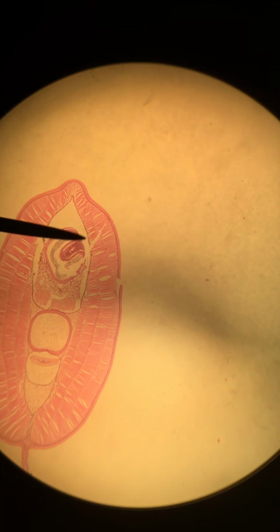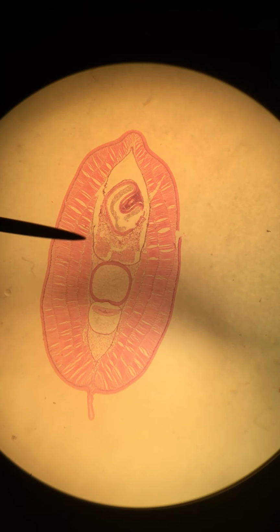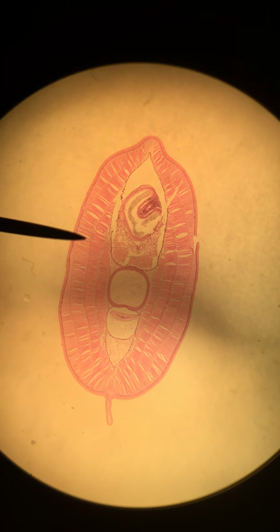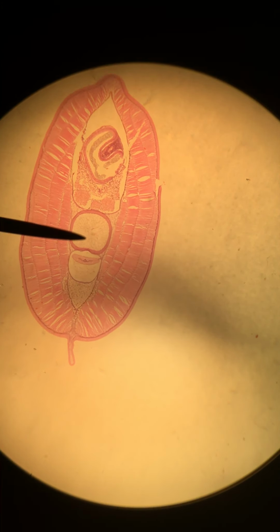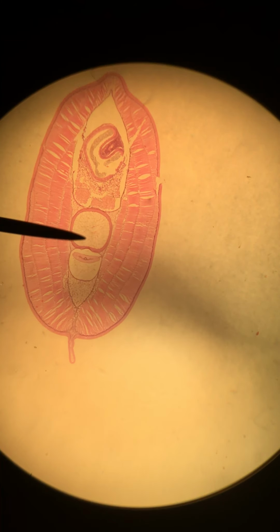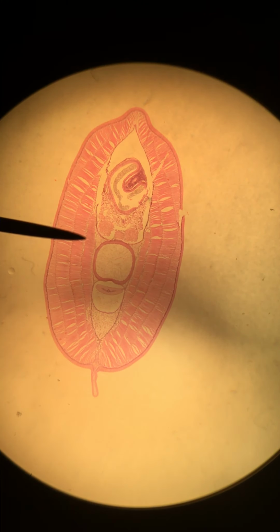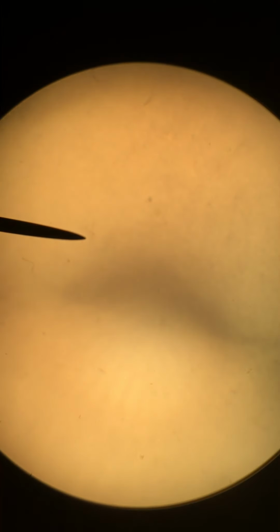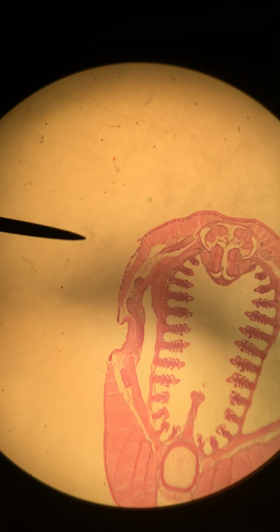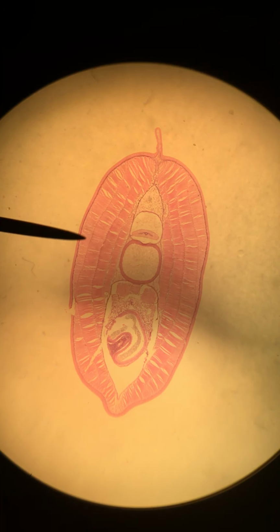So we are going to go to the next most caudal section. Unfortunately, our slides are not always made as clearly as we would like. This one, if you notice, is actually upside down compared to the one we just looked at. This is the notochord. This is the spinal cord. Just to make things clearer, I'm going to take a second and flip it so that everything is oriented the same as it was a minute ago. Okay, and here we are.